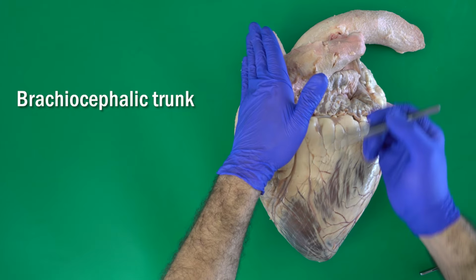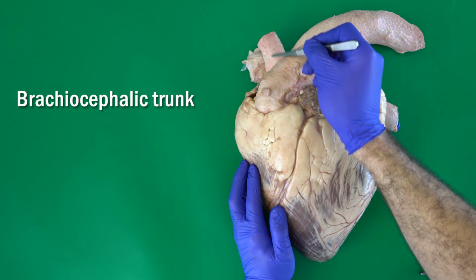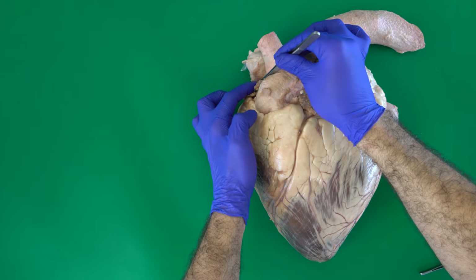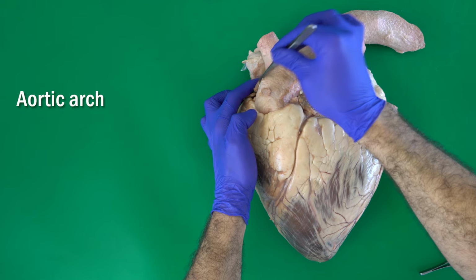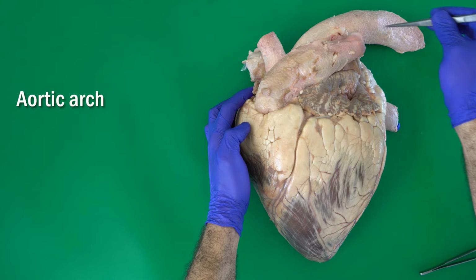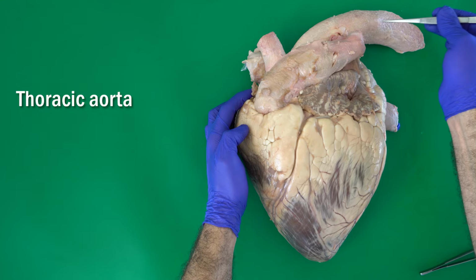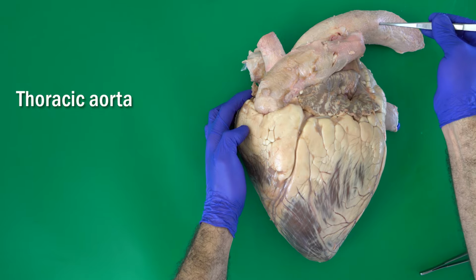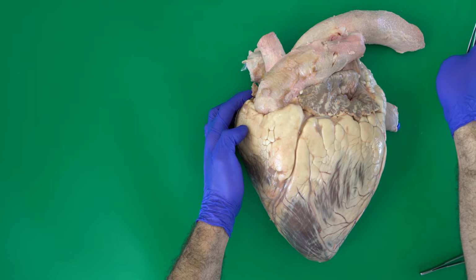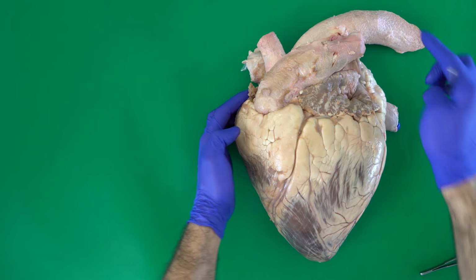The second branch is this big one here, which will move cranially. This is the brachiocephalic trunk. The aorta itself forms at the beginning what's called the aortic arch. After that it moves caudally inside the thoracic cavity. We name this part the thoracic aorta, and after that it penetrates the diaphragm to the abdomen, where it is called the abdominal aorta.